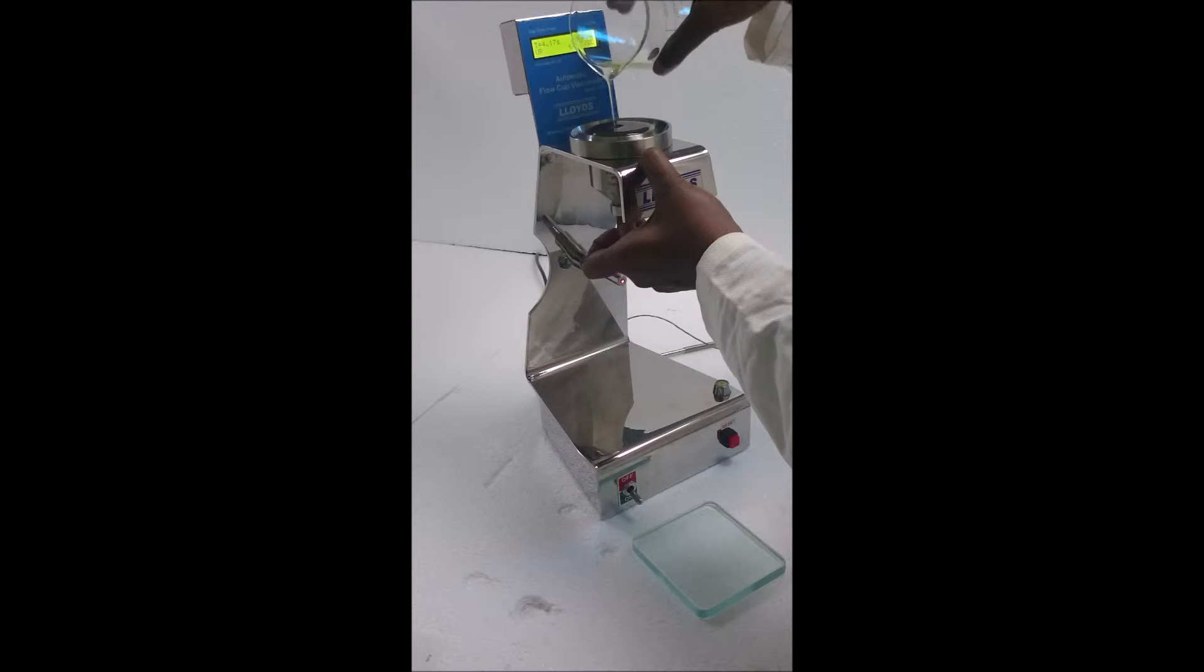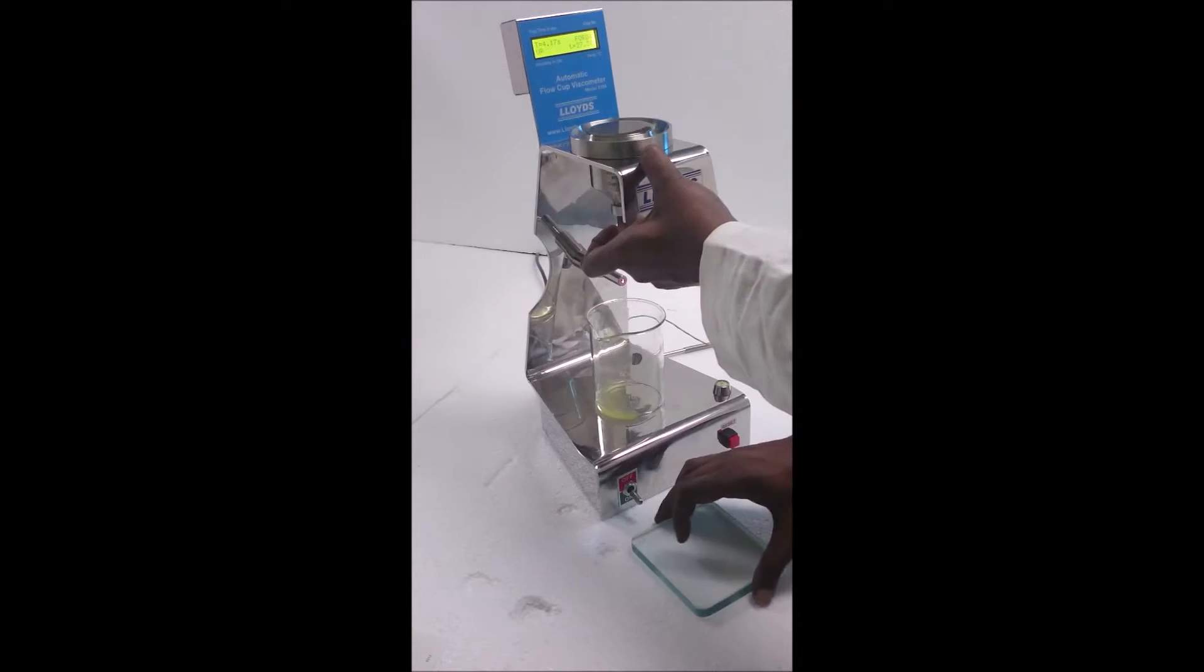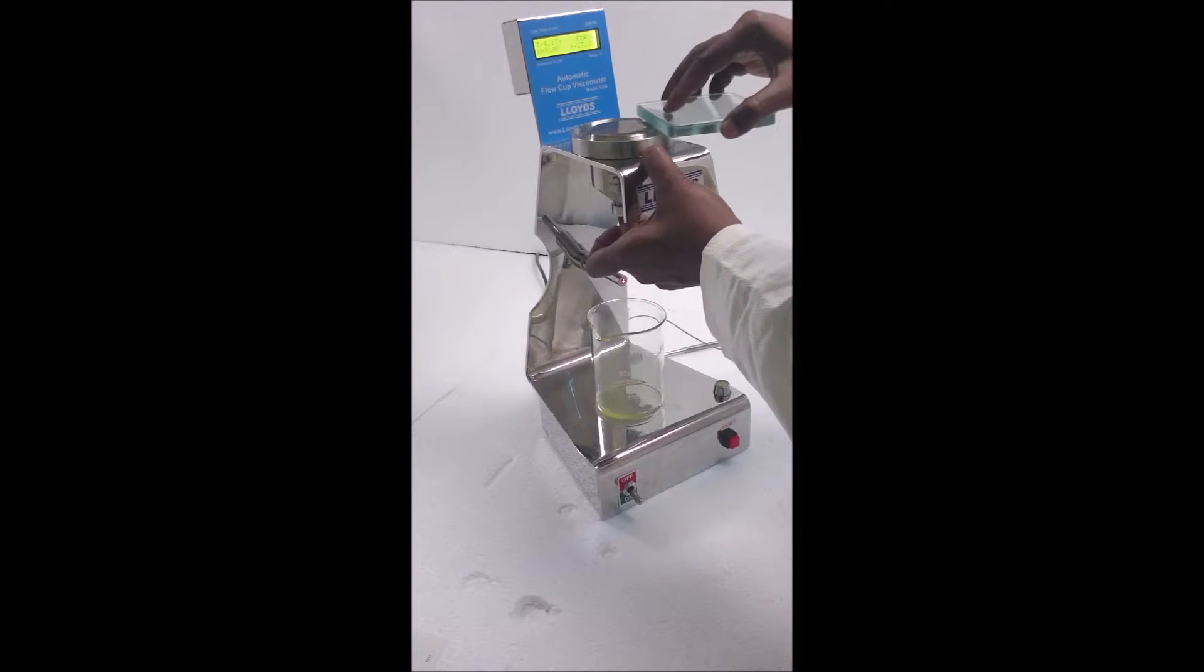Seal the cup orifice with fingers and fill with test fluid. Level the top of the fluid with a glass plate.